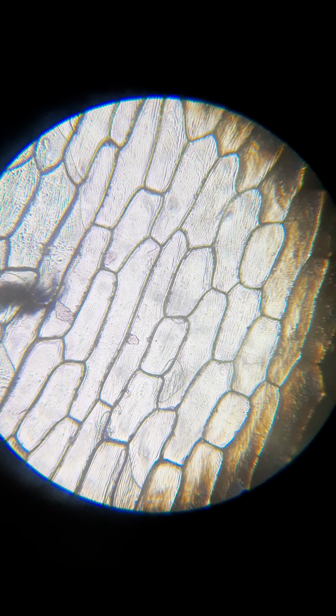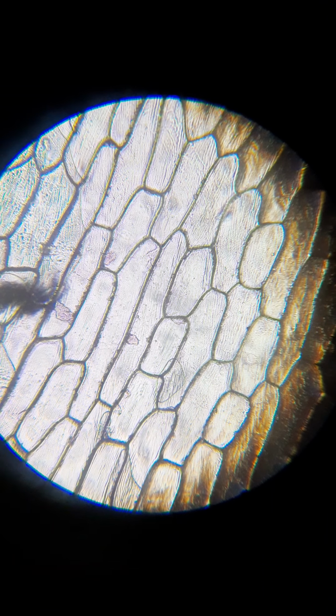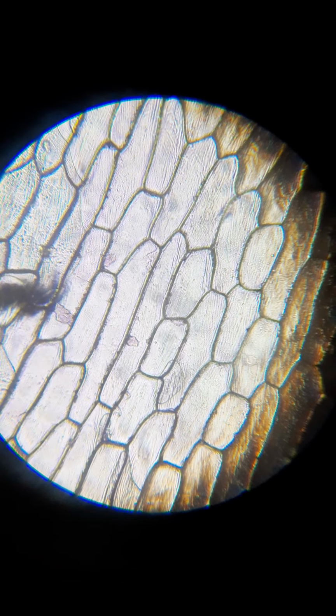To look at this, I'm going to stick a hypertonic solution onto the cells. Basically what that means, well, I'll just skip that part. I'll explain what's happening on the board. Let's go ahead and just stick this under. I'm going to take the scope off of this for a sec so I have room to stick this special water on. So bear with me, it's going to go dark, and I'm going to stick this with my syringe without spilling over and getting onto my lens.